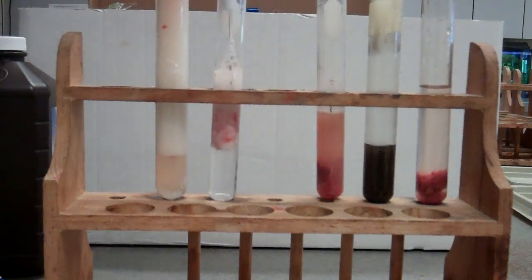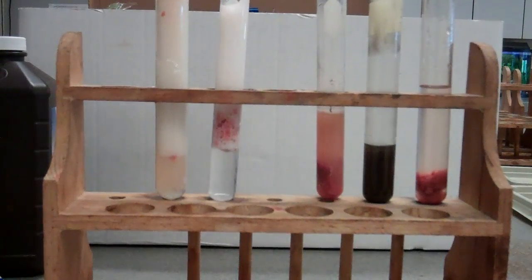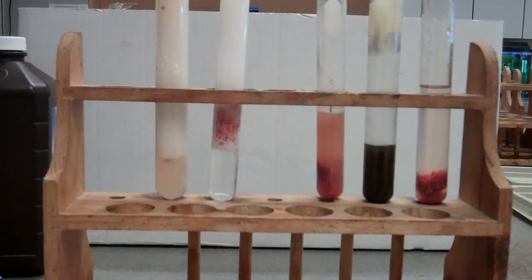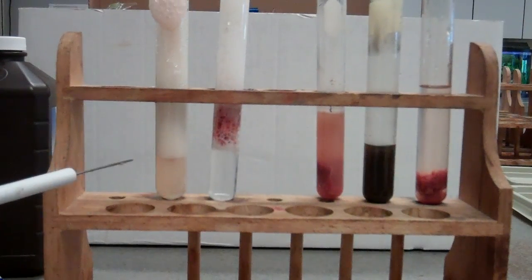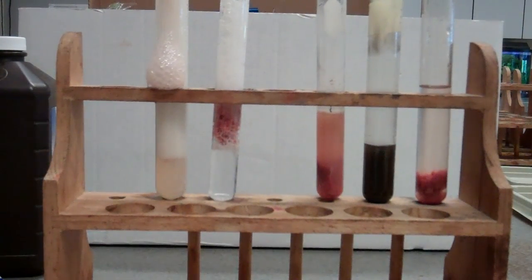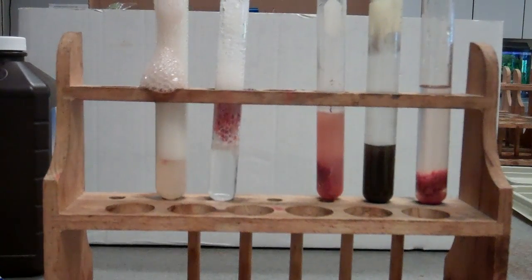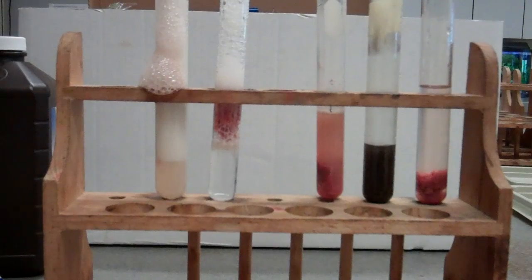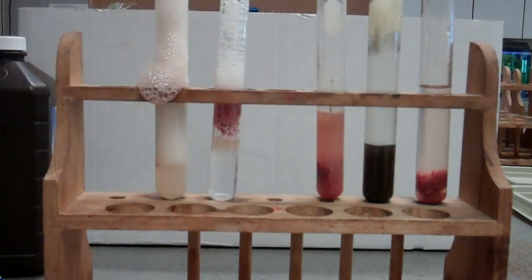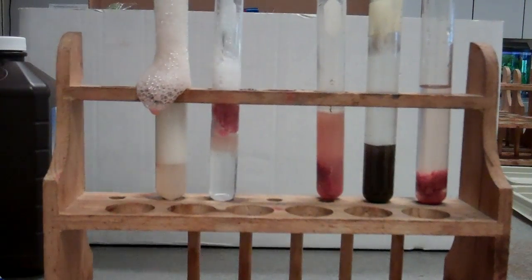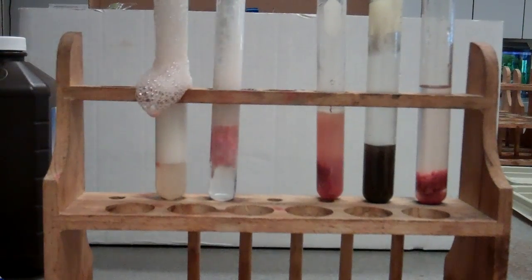And we see it continue with the reaction. Now this one's continuing as well because there's bits of liver still left in there, actually. But we still see the reaction occurring in this next test tube. Even though the liver has already been used here, it is still working in this new test tube of H2O2.